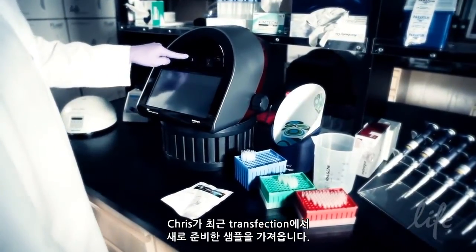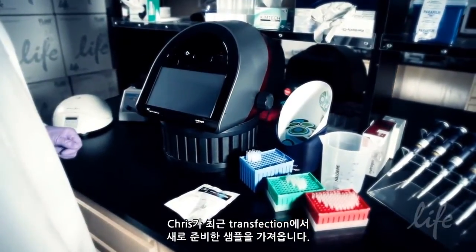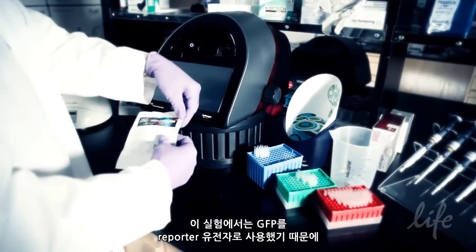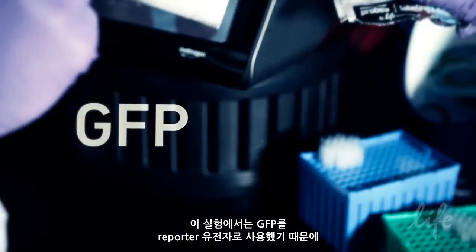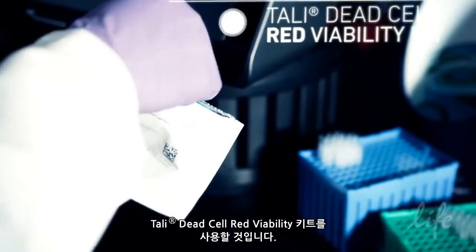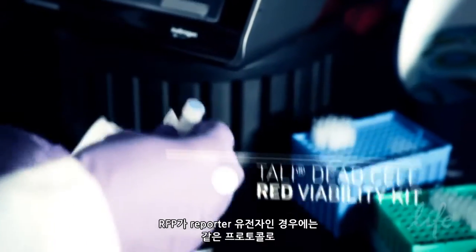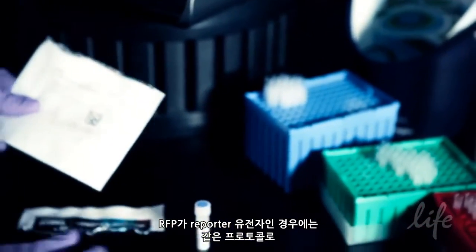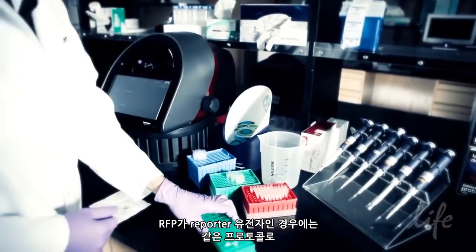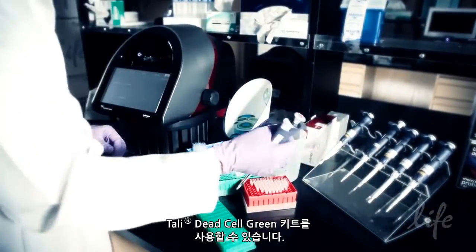Chris has a freshly prepared aliquot of a sample from a recent transfection. In this experiment, GFP was used as the reporter gene, so he will use the Tali Dead Cell Red Viability Kit. However, the same protocol can be used when RFP is the reporter gene, using the Tali Dead Cell Green Kit.